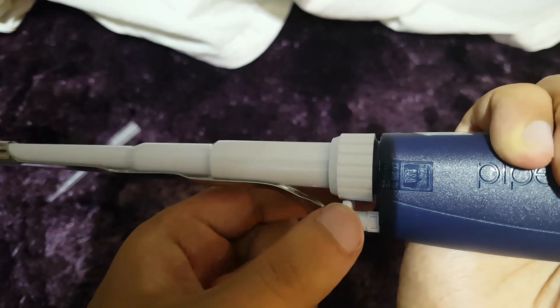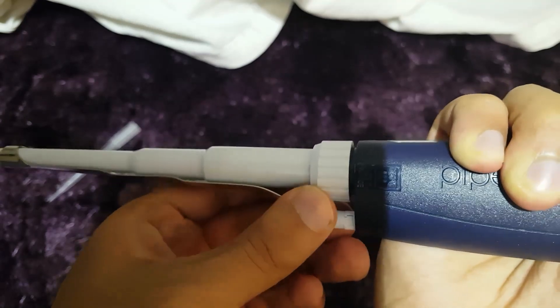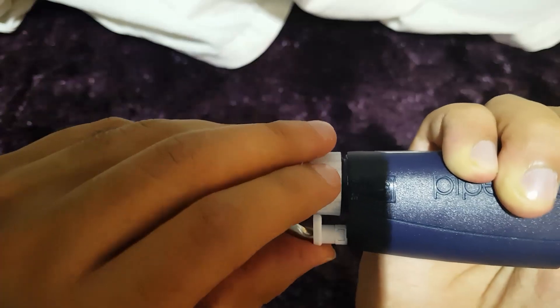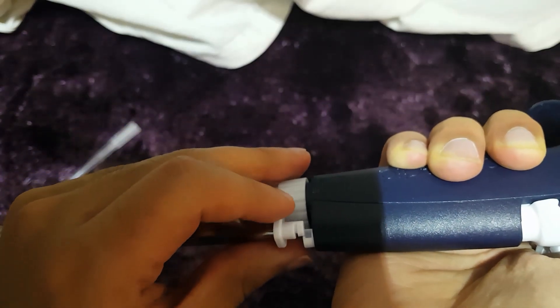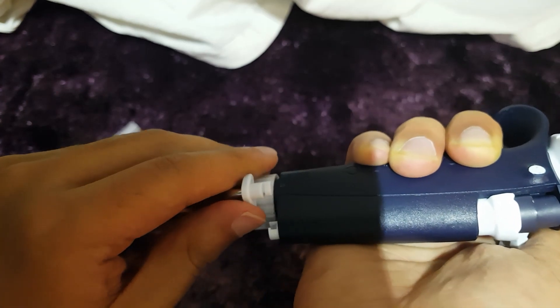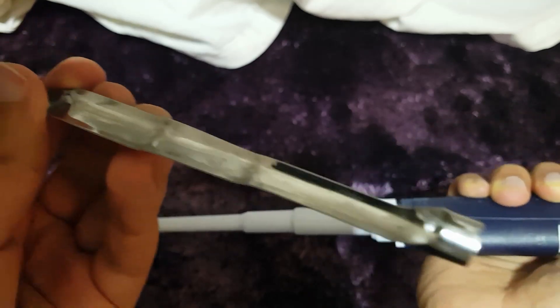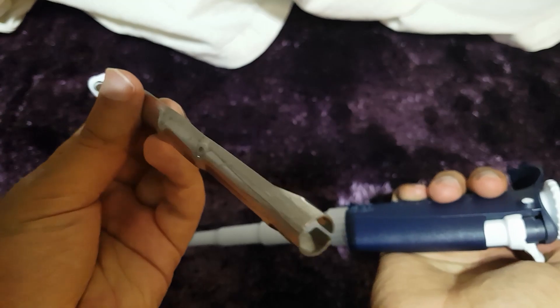What we can see here is that there is a little hole, a sort of little thing there. What we have to do is try and get the arm out of there — it simply clicks out. You push it up here, you hear it click, and you can take off the ejector arm, which you can clearly see there.